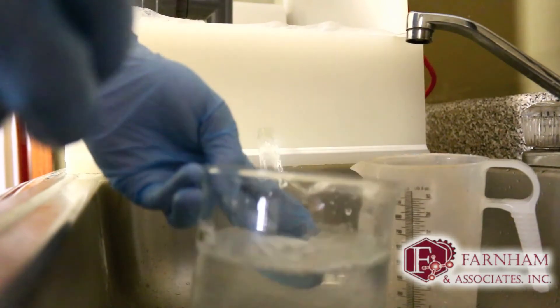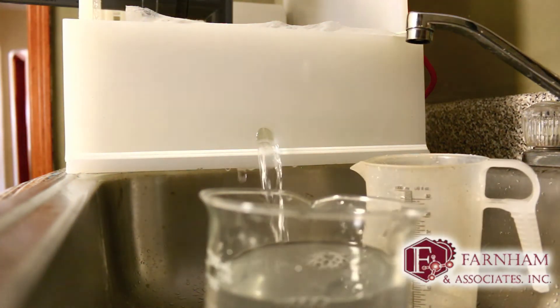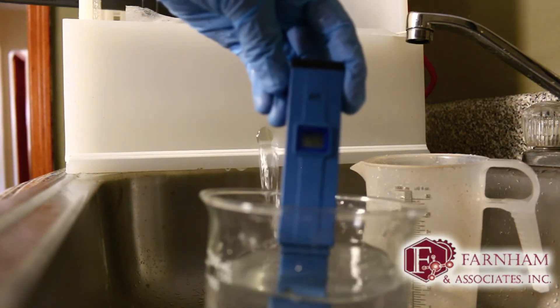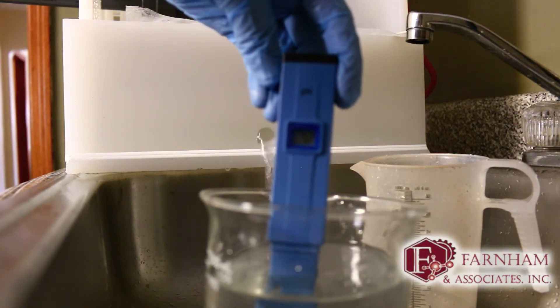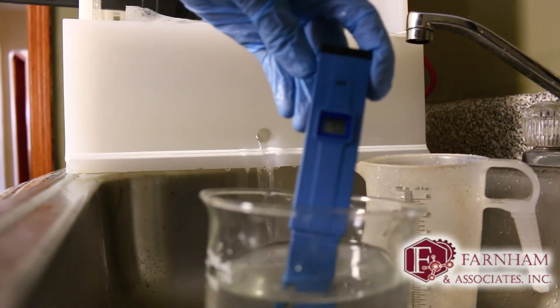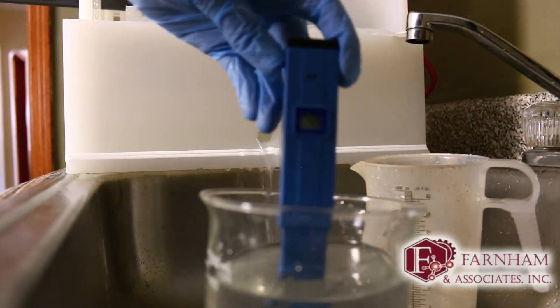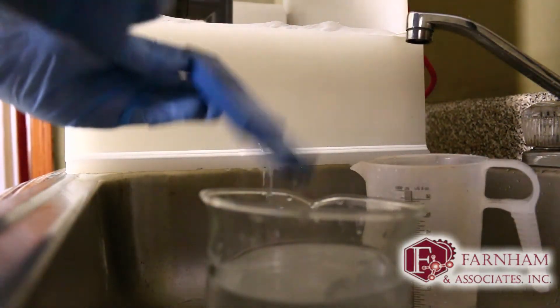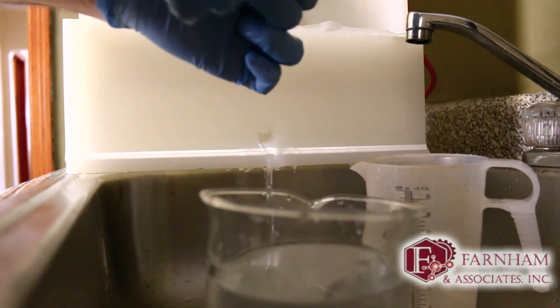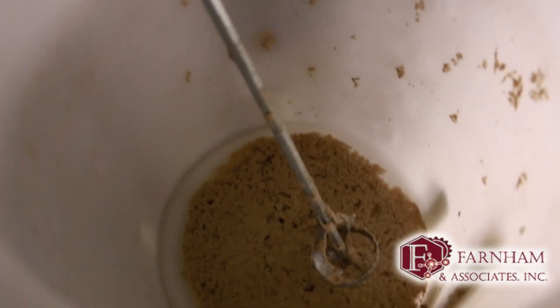Let's check the pH on the filtered water — actually a little low, 5.2. Yesterday I brought it from a 10.4 down to a 7.4, and today it started at 8.5 and we're down to 5. So it drops it pretty significantly. I think that's giving us some clues as to the dosage and where exactly we're supposed to be with that.